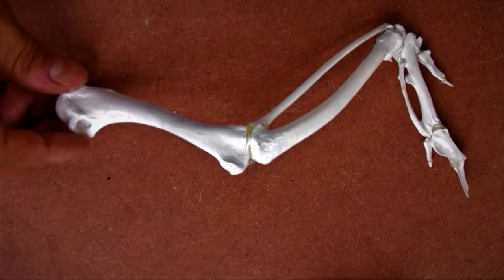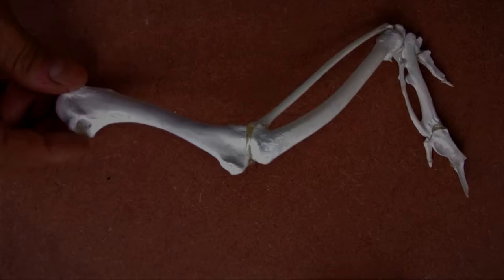In the previous video, I showed how the wing bones articulate. We now proceed to articulating the ribs.